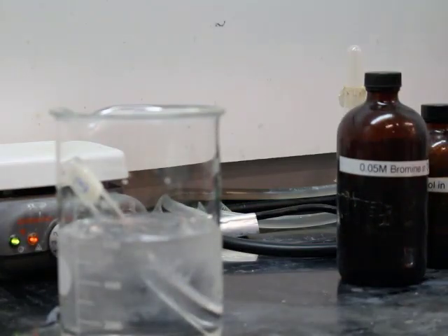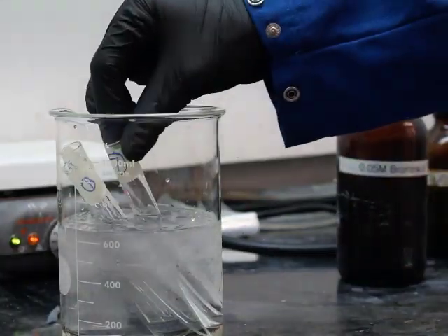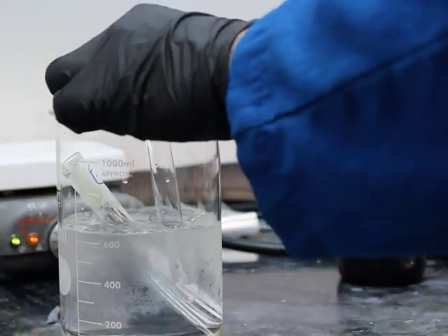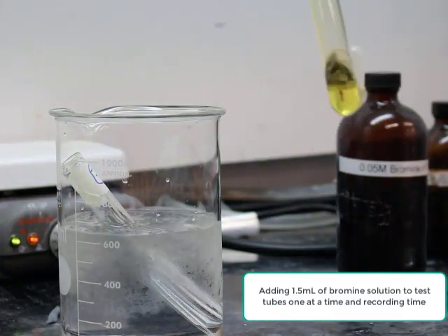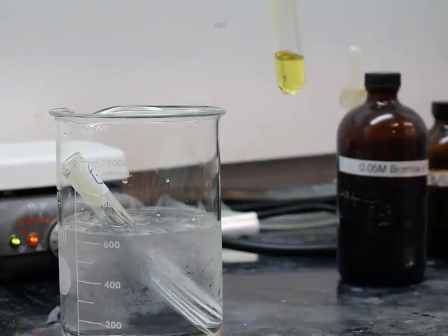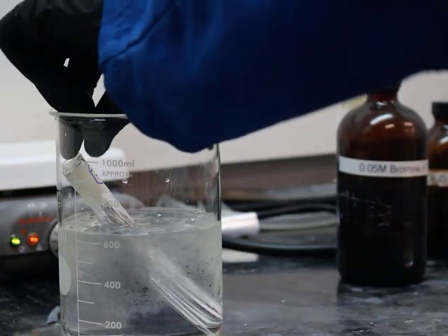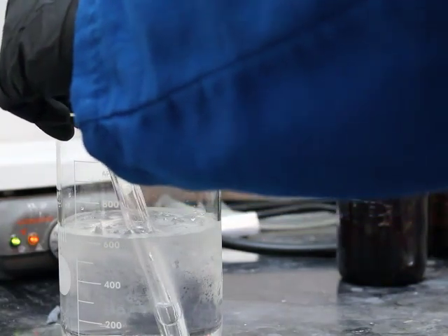Due to that, that's why we're putting them in the ice bath. We're going to chill them a little bit. Putting it in, that was yellow real fast. Looking at phenol, even under cold conditions, that one still happened exceptionally fast. So about 24 seconds. Looking at test tube number two, anisole.